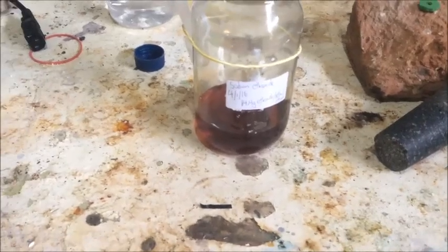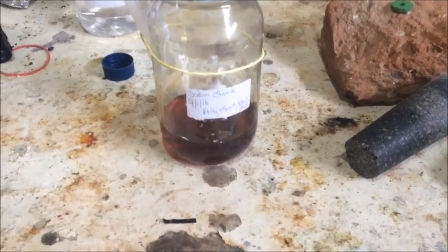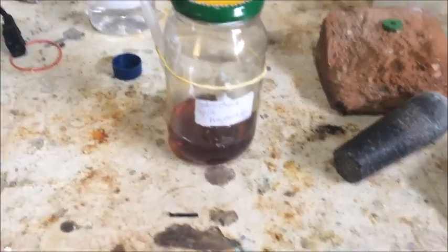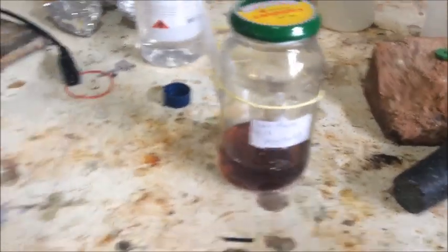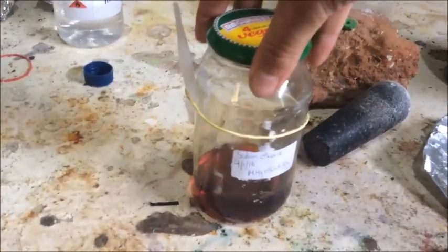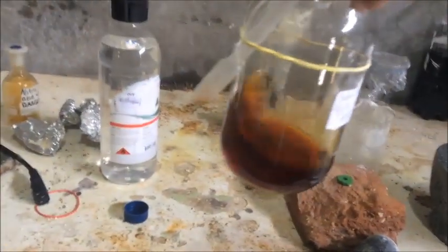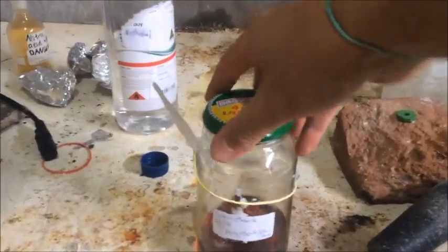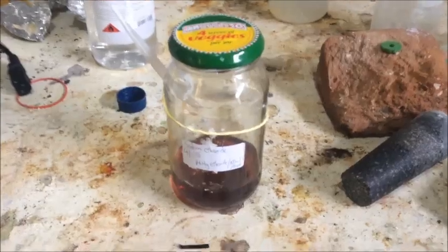I also don't know why it's doing it. Possibly a strong base with organic solvents could be doing some condensation product thing. It's really odd, because when it looked like the light green, it didn't really look that impure — there's a bit of green stuff in it, but it's not too bad. But now it looks dreadful. Whether it's actually more impure than it was, or it's just the same level of impurity in a different colour, I don't actually know.